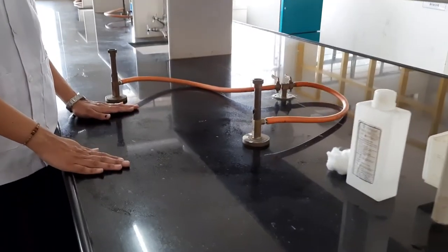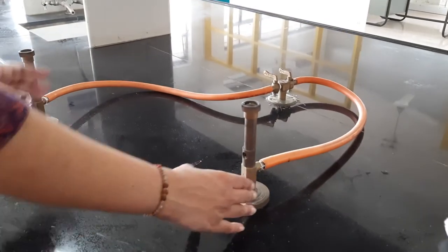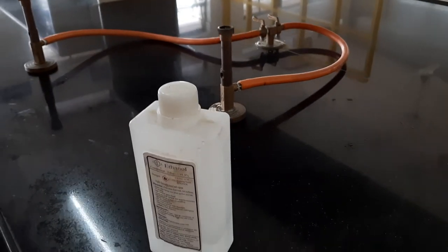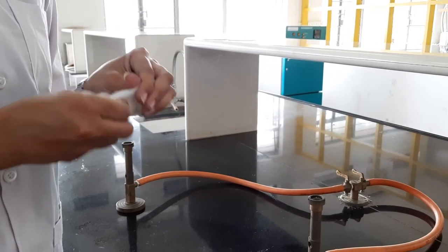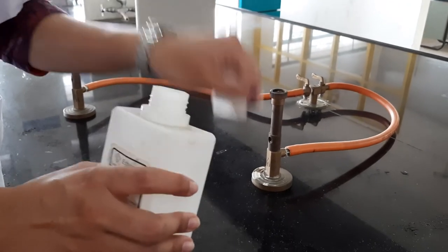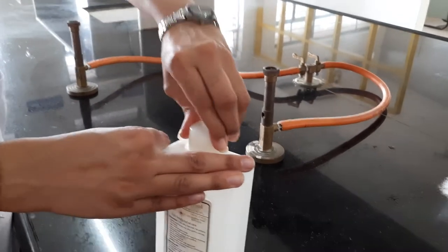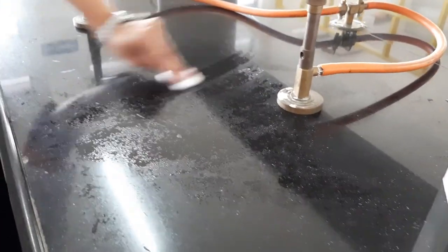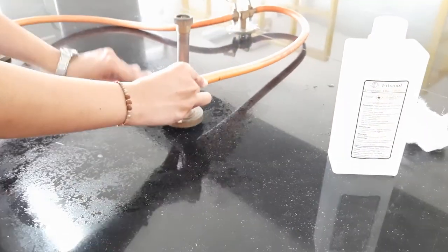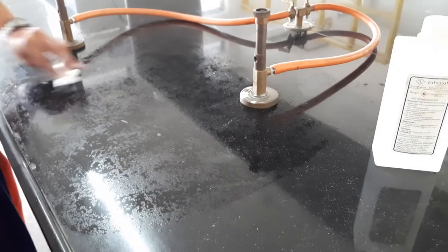The very first step while performing the practical is to sterilize the platform. I have thoroughly cleaned the platform and now I will disinfect it using alcohol — specifically ethanol. I will take a small portion of cotton, take the ethanol, and disinfect the platform where I have to perform the practical. Make sure your burners are off while performing this disinfection process, otherwise the alcohol can catch fire.